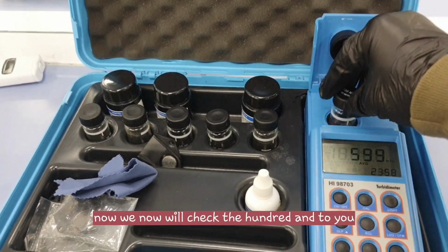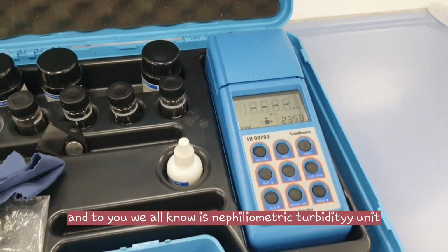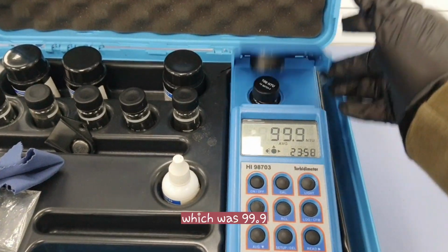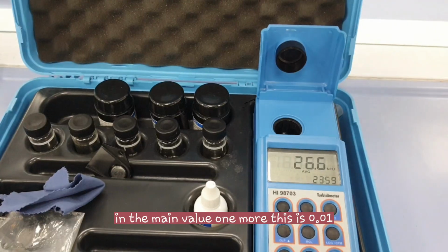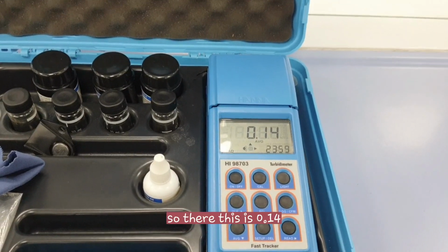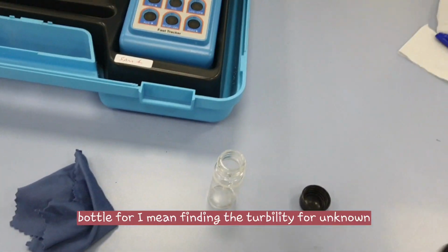Now we'll check the 100 NTU. The NTU, as we all know, is the Nephelometric Turbidity Unit. It shows 99.9, which is okay. It's not much deviation from the main value. One more, this is 0.01. It reads 0.14.